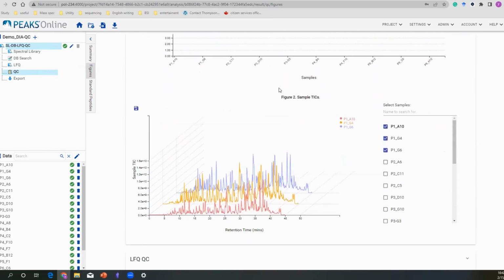Here we give our TIC chromatogram, and you can select a sample. It's the same idea as what we showed earlier in the search button function. You can also search in here. Let's say you only want to watch P1, so you can have P1, and we also have P12 here. But you can select any one. Let's say we want to keep our P1, but I want to update to also compare some from P2. So by a simple click, okay, here you have that.